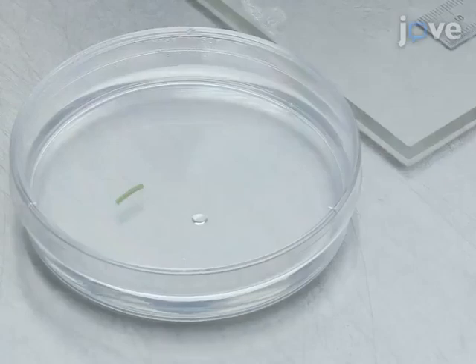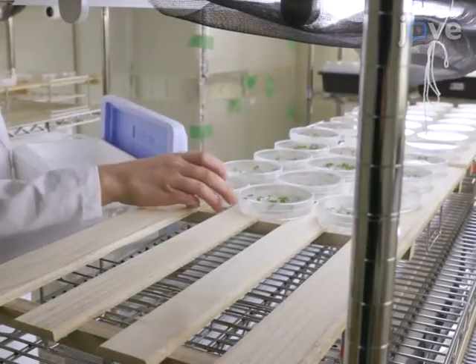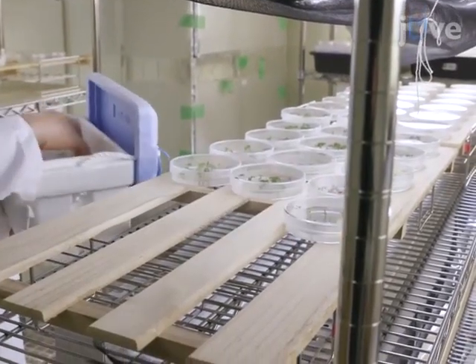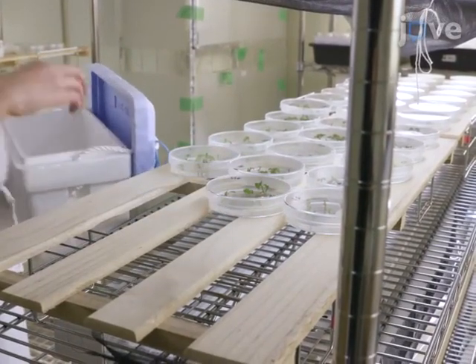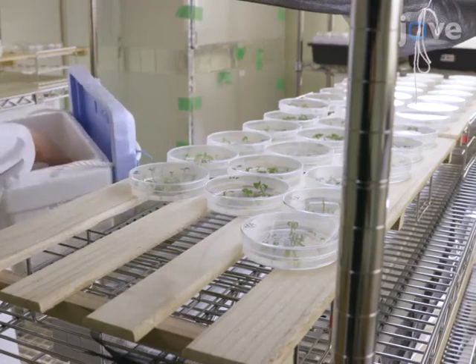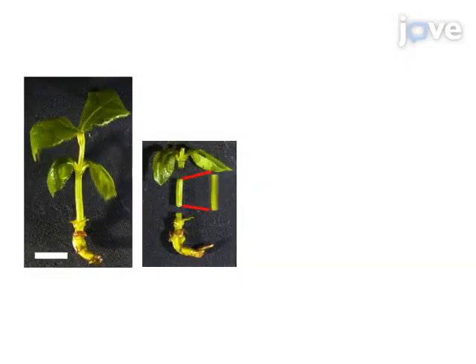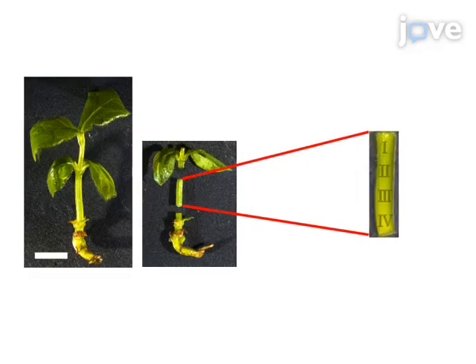Then culture the Ipecac segments at 24 degrees Celsius under 15 micromole per square meter per second of light in a 14-hour light, 10-hour dark cycle for 5 weeks. After culturing the Ipecac segments, identify regions 1 through 4 in each segment.